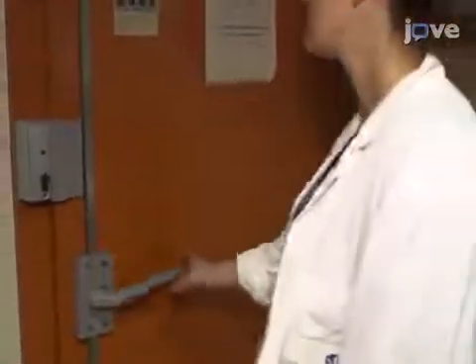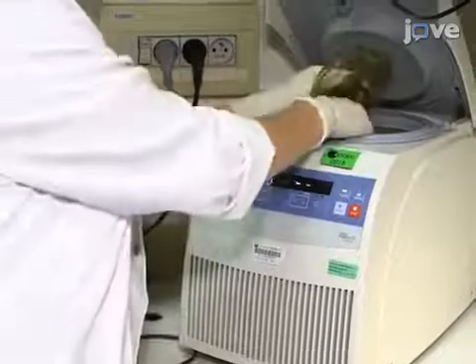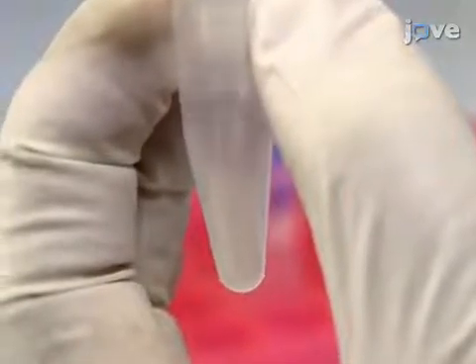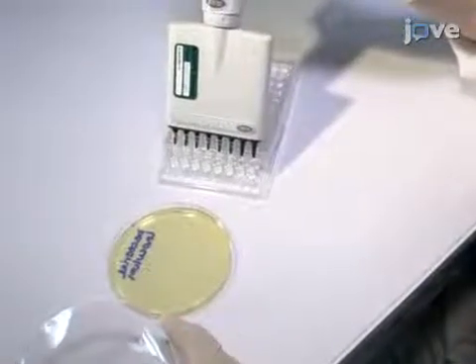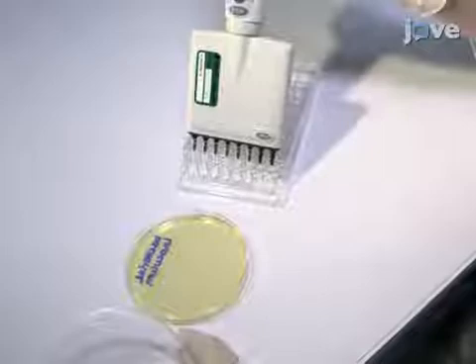After growing an overnight culture of uropathogenic E. coli, or UPEC, according to the text protocol, spin the bacterial suspension in a tabletop microcentrifuge at 17,000 times G for one minute and resuspend the resulting bacterial pellet at 2 times 10 to the 8 CFU per milliliter in PBS. Serially dilute an aliquot of suspension and plate on LB agar, with antibiotics if appropriate, to determine the exact inoculum for each infection.